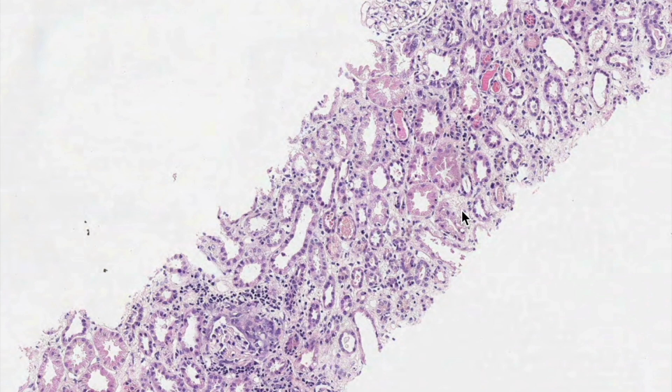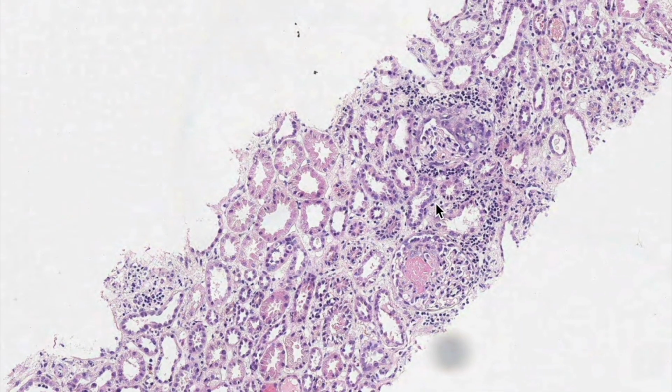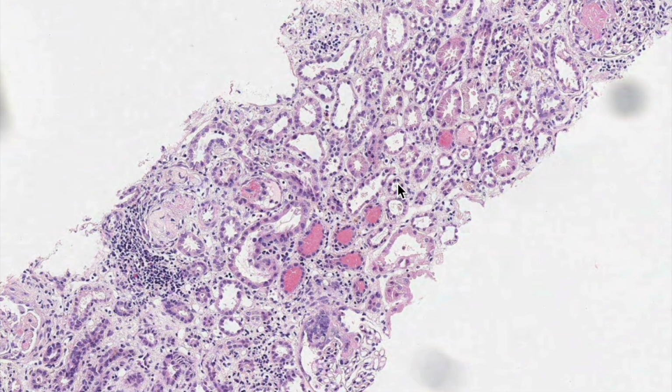While going on to the detailed discussion in our regular course, I'll definitely go over what all pointers to look for, because in a kidney biopsy you have to mention how many cores are present first. Second, you have to mention the number of glomeruli in each core, and the number of stroma and the number of tubules, and then what is the problem with the glomeruli, right? And then with the tubules, and then with the interstitium, and you'll have multiple stains. It's not only H&E, you'll have PAS, you'll have Jones, and immunofluorescence as well, right?